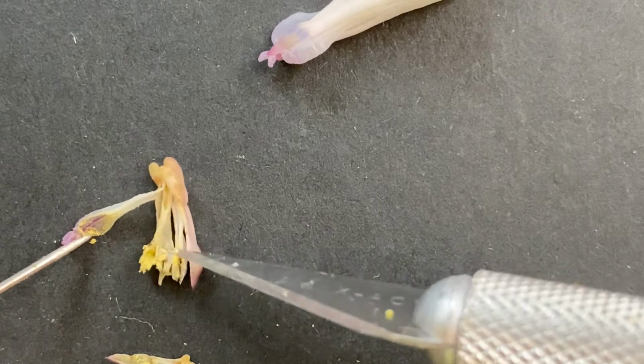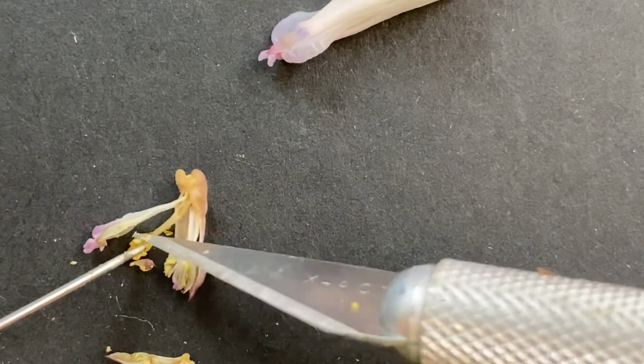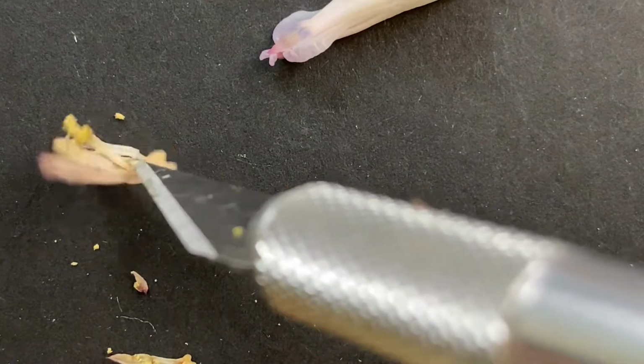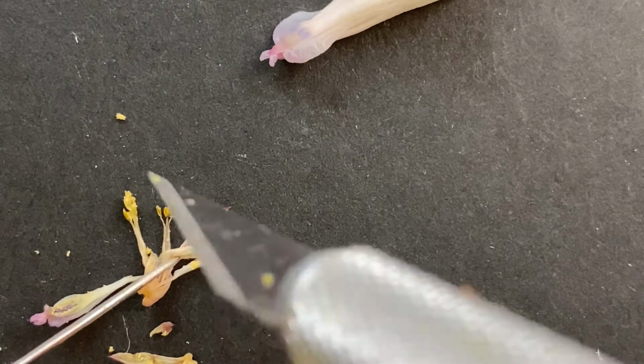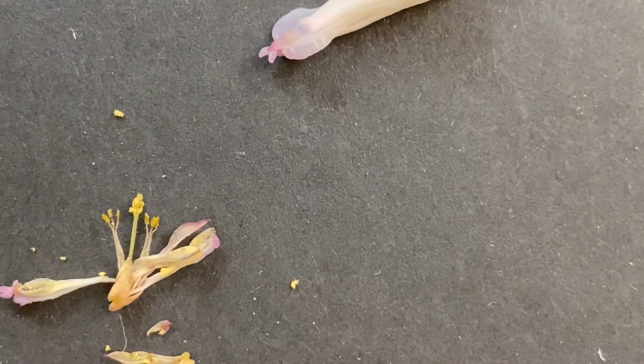So they're just self-pollinating in there, and hopefully we'll get to pull this apart. Yeah, a little bit. They're so tricky when they're small. There we go. All right, so there are 3 stamens or stamina on this side, and then there are going to be 3 on the other side. Like that. And then right in the center is the pistil.